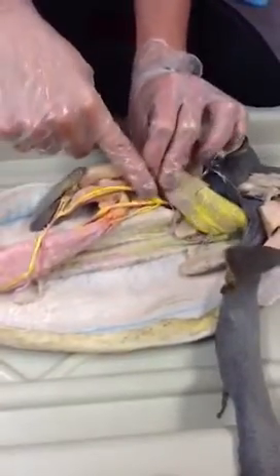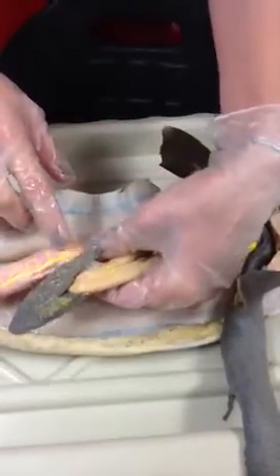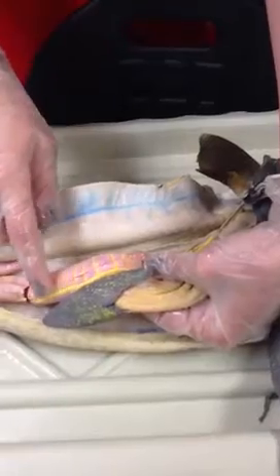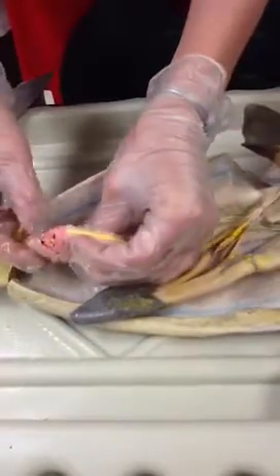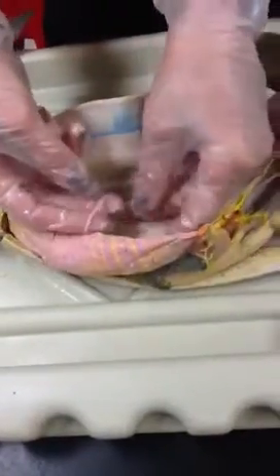We have our hepatic portal vein, which is going to continue on to our intestines, which is not divided into large and small. This is our anterior intestinal artery and vein with our annulars that each go over a spiral valve inside. So you can see that yellow spiral valve in there. And then coming down here is our posterior intestinal artery and vein. So that's going to be this artery.